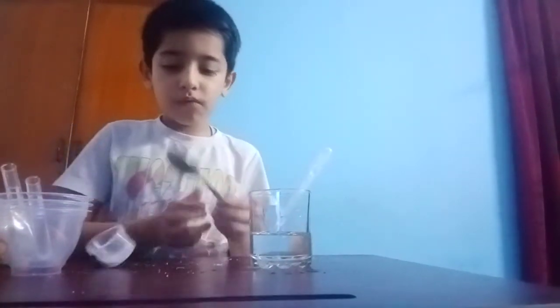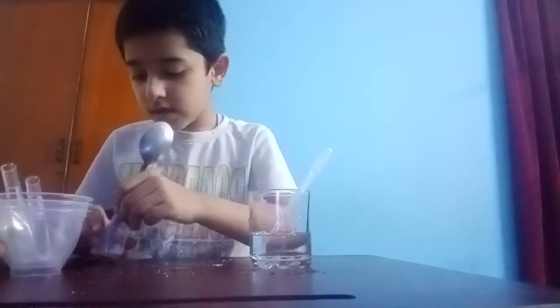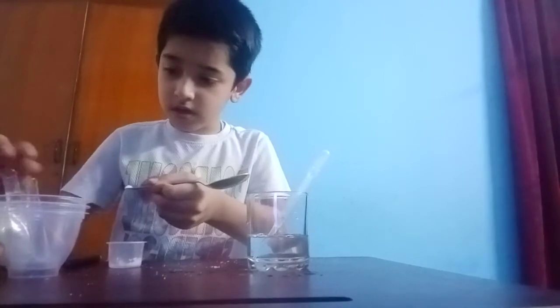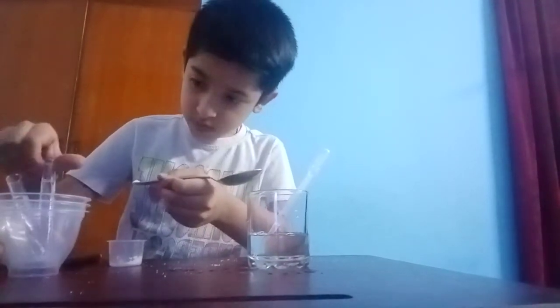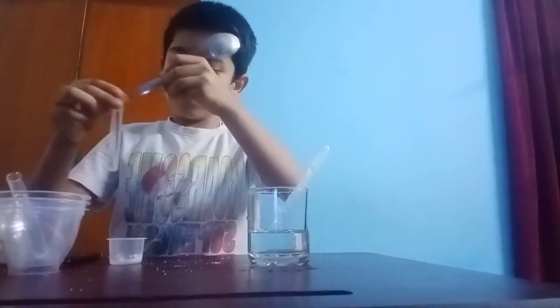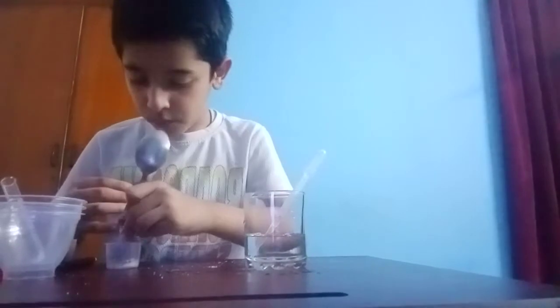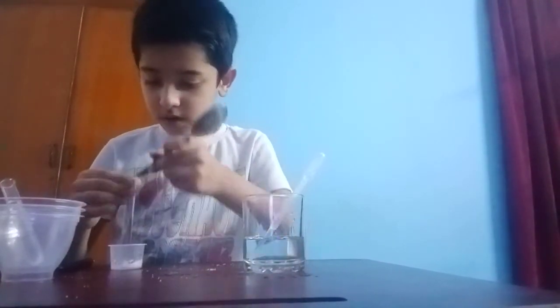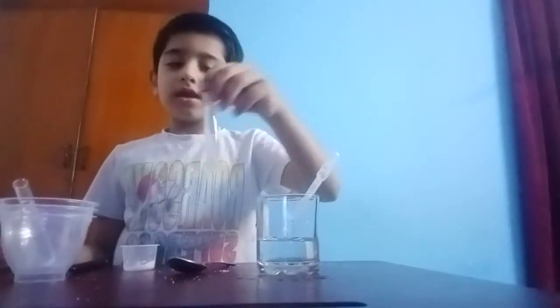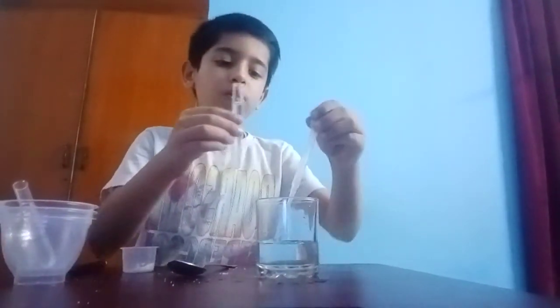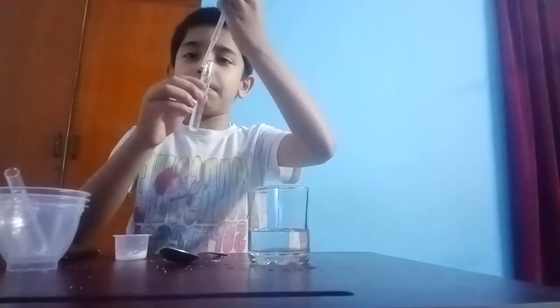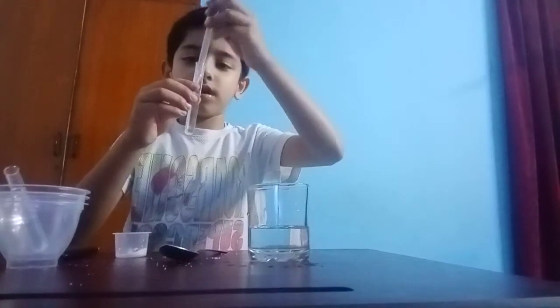Now we will add salt in the salt test tube. Like this. I will pour more, a little bit. Okay? Then I will mix it. You can mix it with the pipette also, like this.